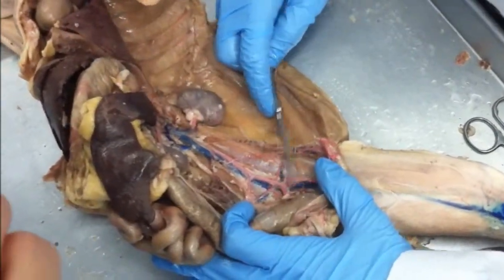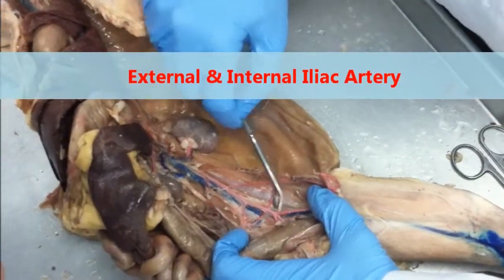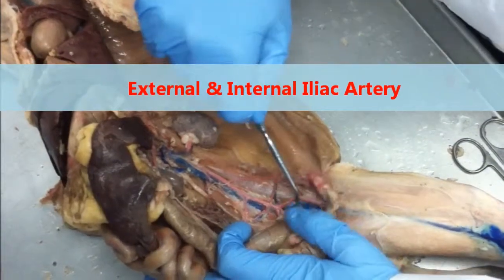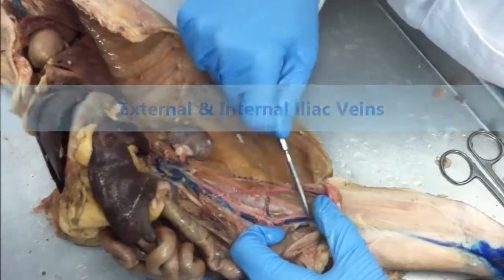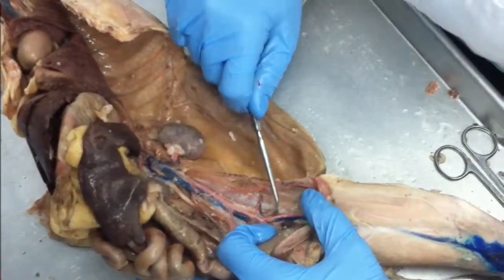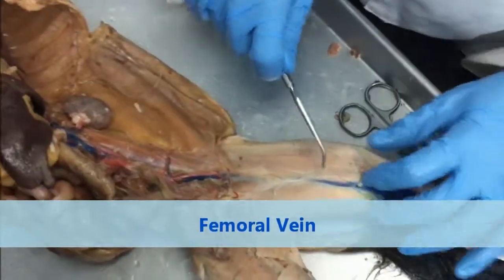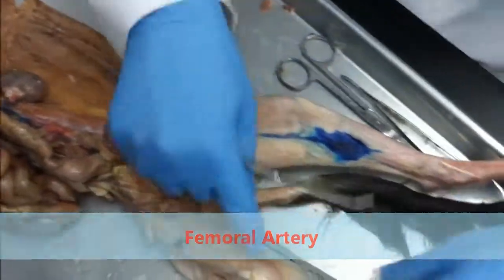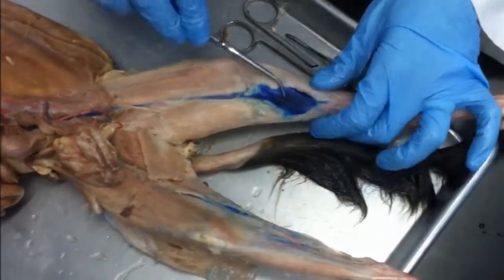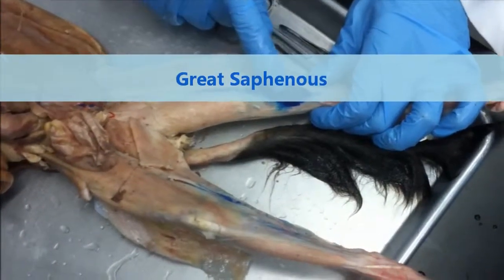Okay? Next down, I've got the legs, external and internal iliac. External on the outside, internal goes deep. For my veins, external is the one that I can see easily. I would have to dissect way further down to see the internal iliac vein. Okay? Once I pass the hip joint, I become the femoral vein and artery. Once I pass the knee joint, this becomes the great saphenous vein, which we can see they injected the dye into the great saphenous vein here. I think that's it. Happy birthday!